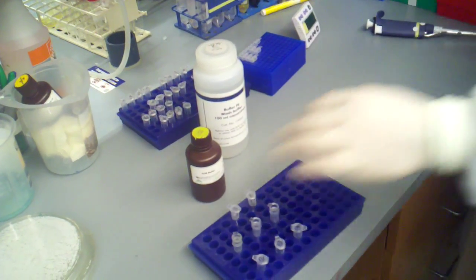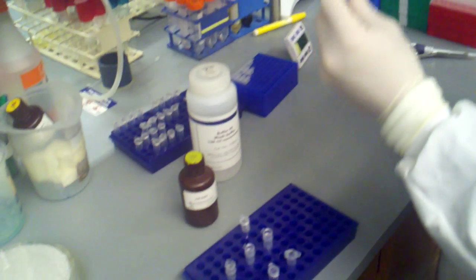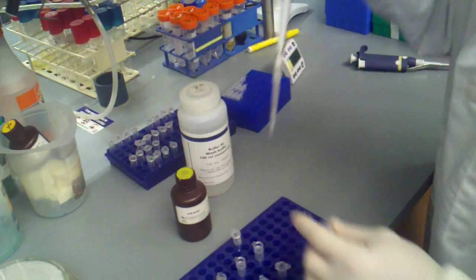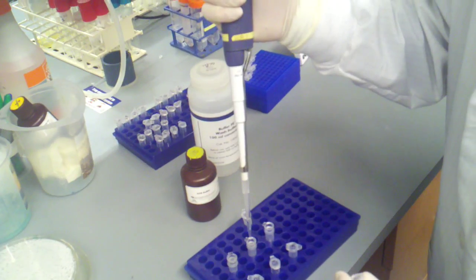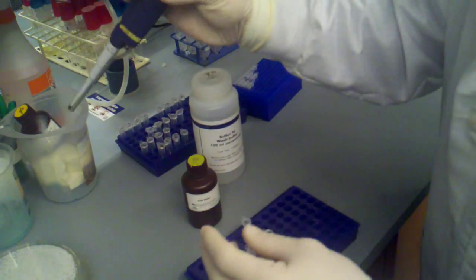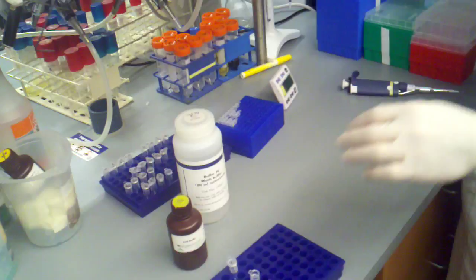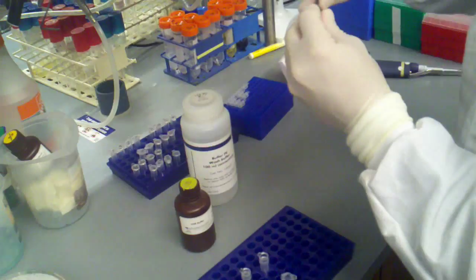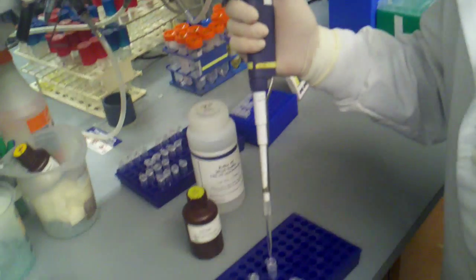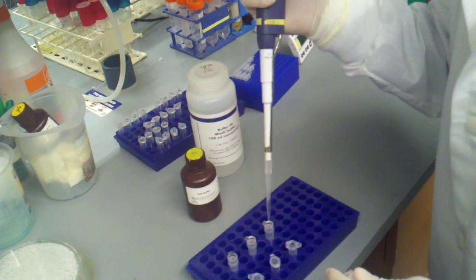So there is sample number one. Sample number two is going to go right next door. Or, actually, sample number three, I guess. That's sample two, that's sample three. We lost sample one. Sample one did not work. There's number four.